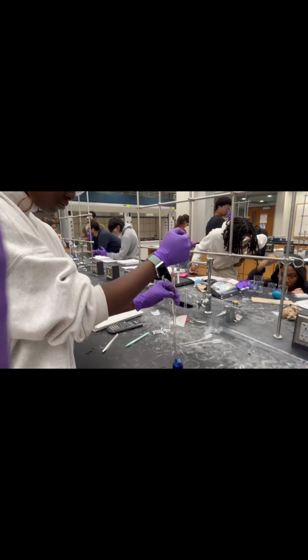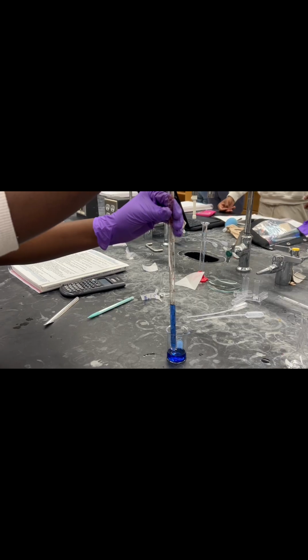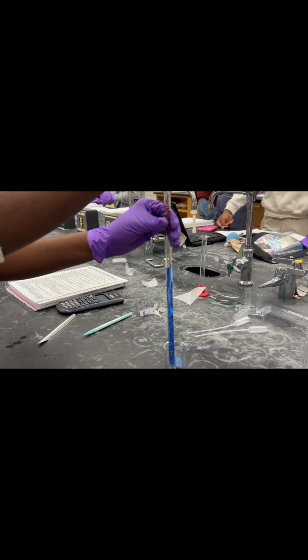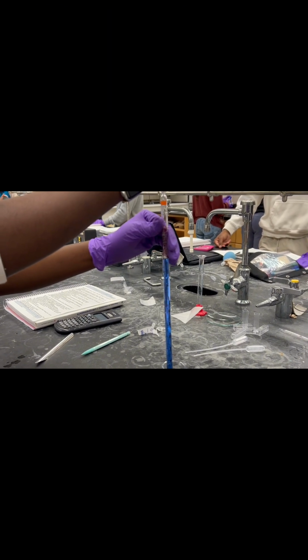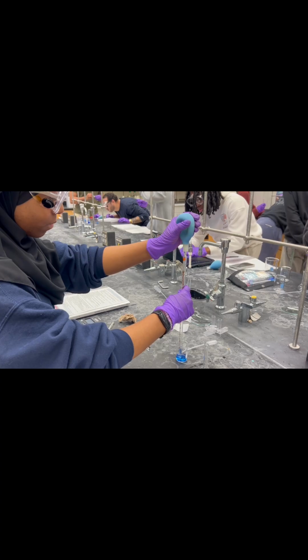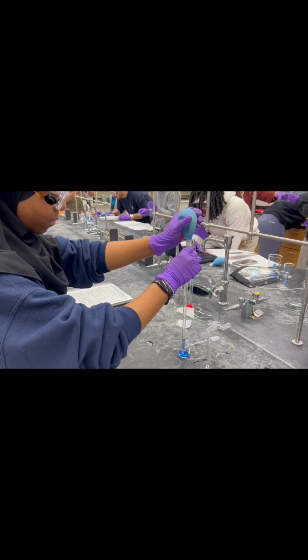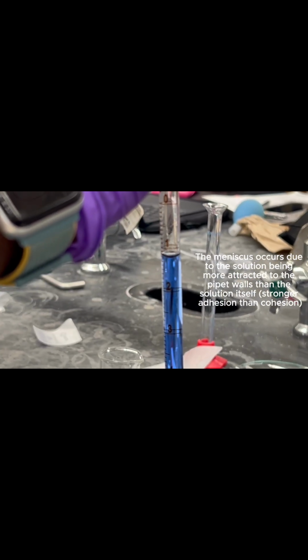Squeeze the rubber bulb and place it on the top of the pipette, which should be suspended in the stock solution, and gently let go of the pressure to draw up some of the solution. Remove the bulb and place your finger over the top of the pipette to keep the solution from flowing out. Bring the pipette to eye level and read the bottom of the meniscus, the curved part of the liquid.